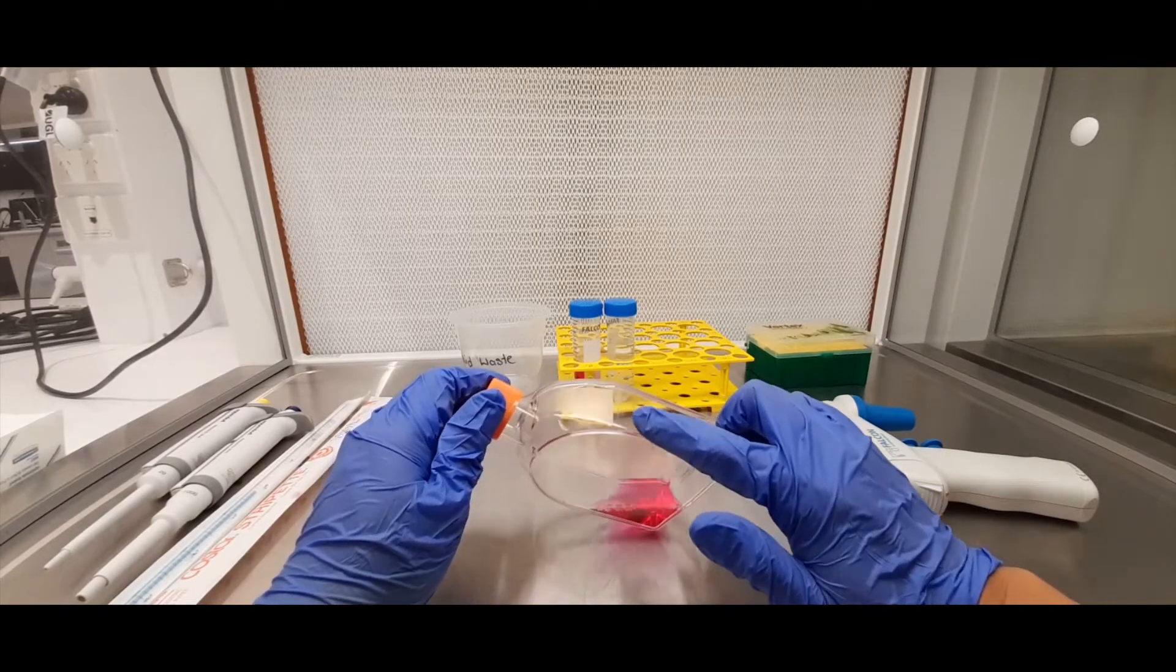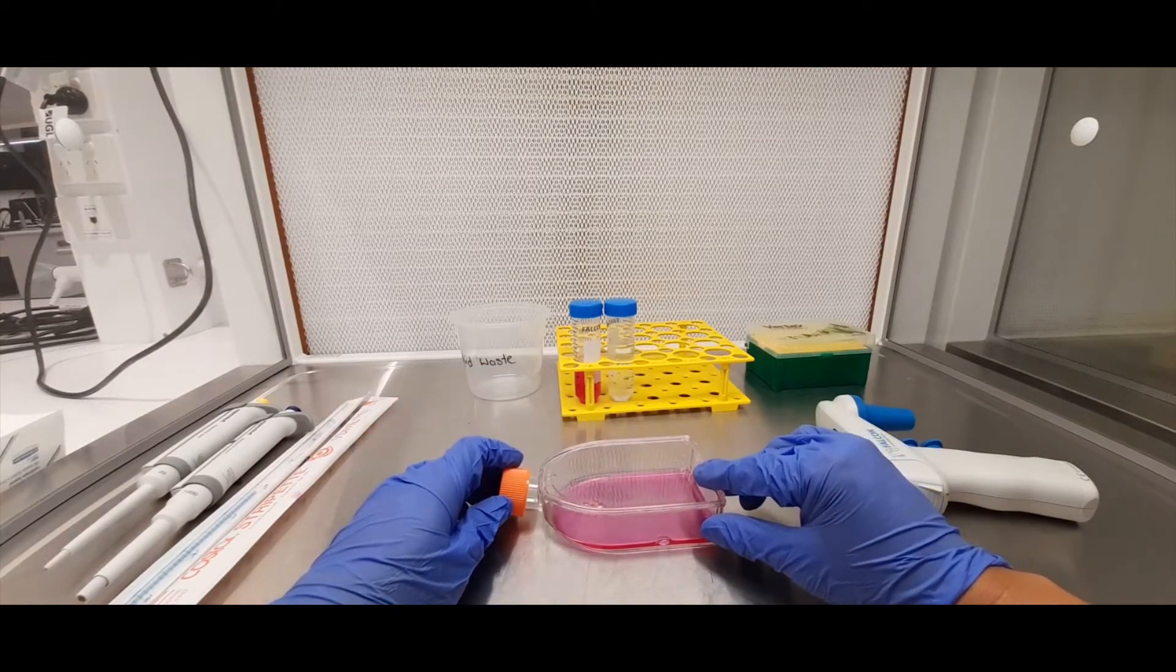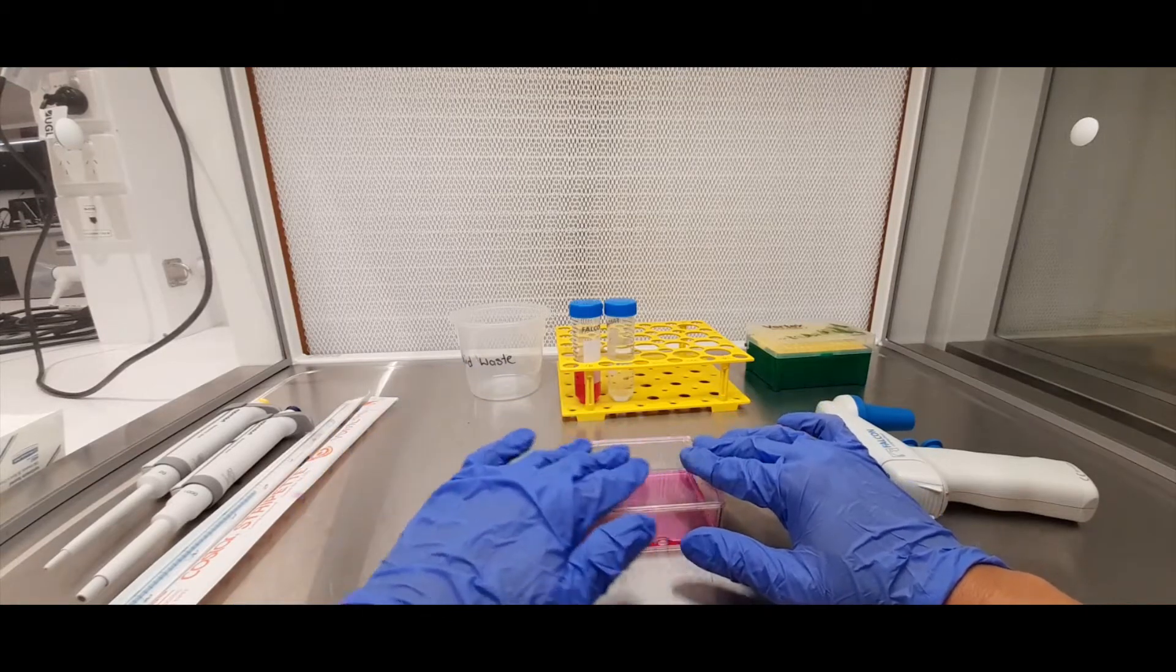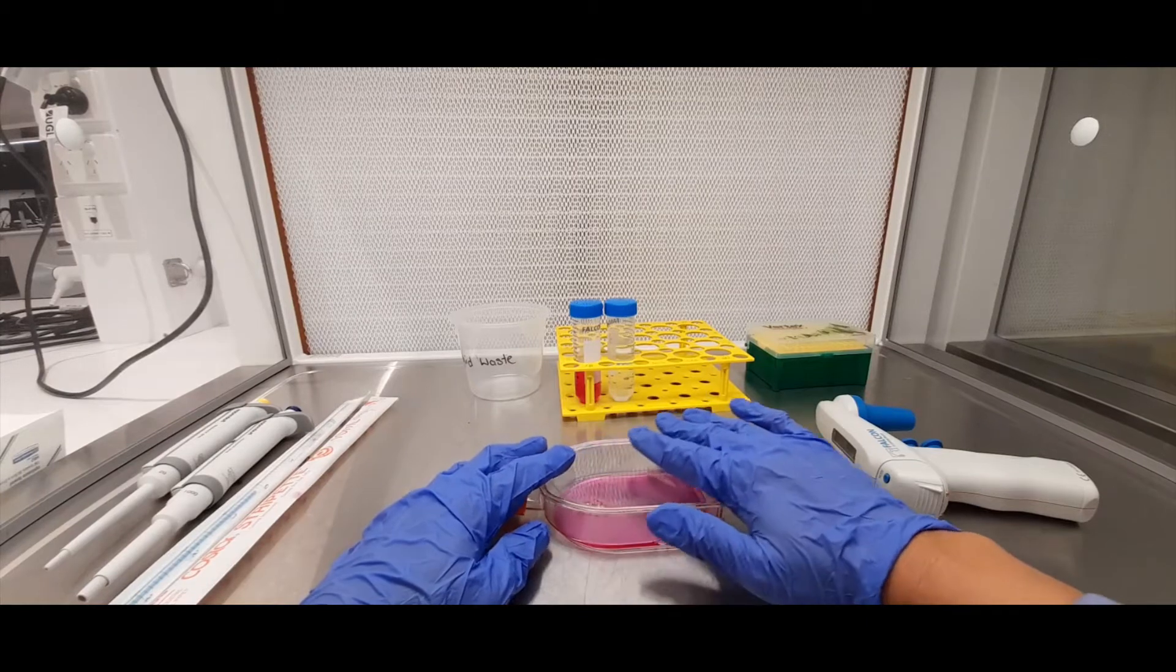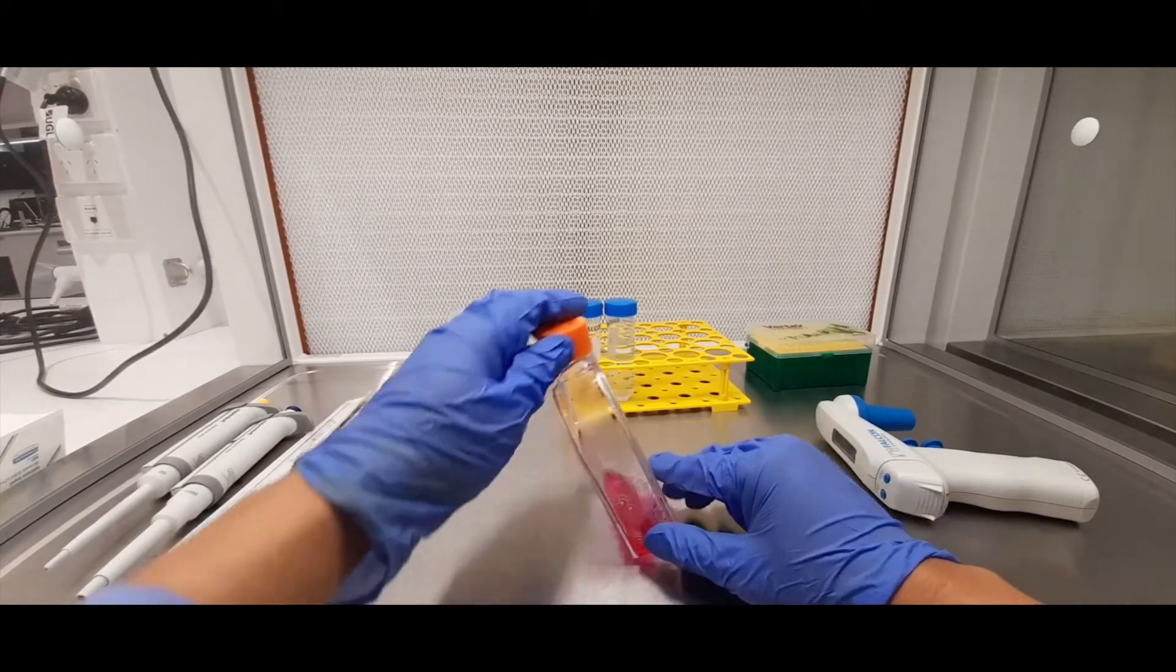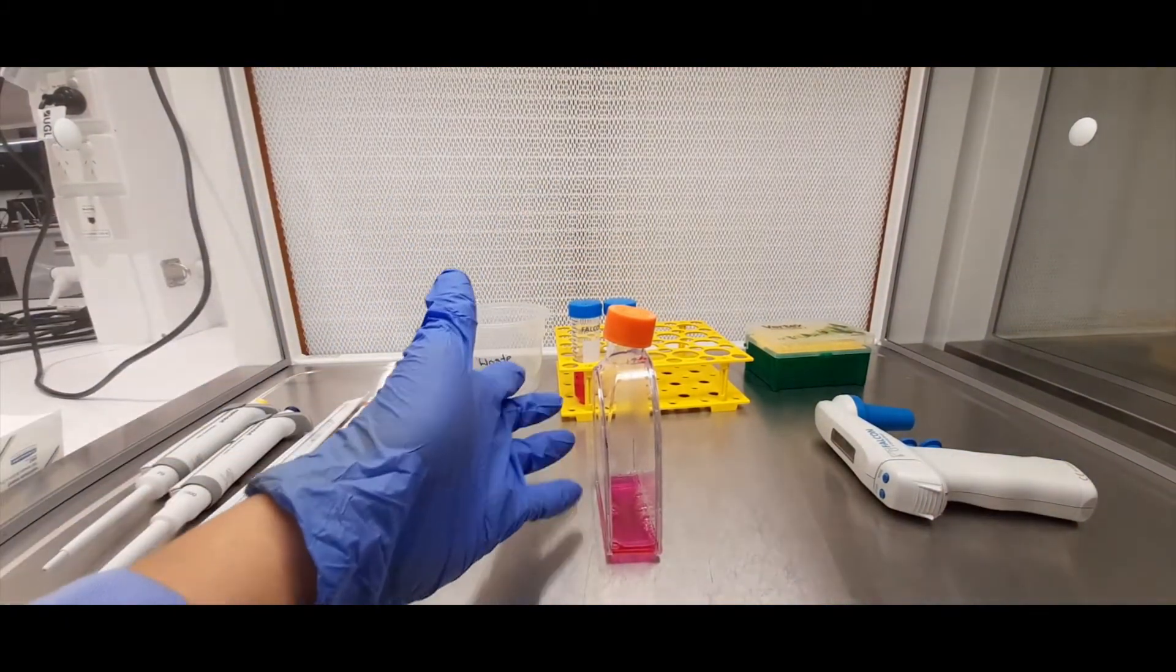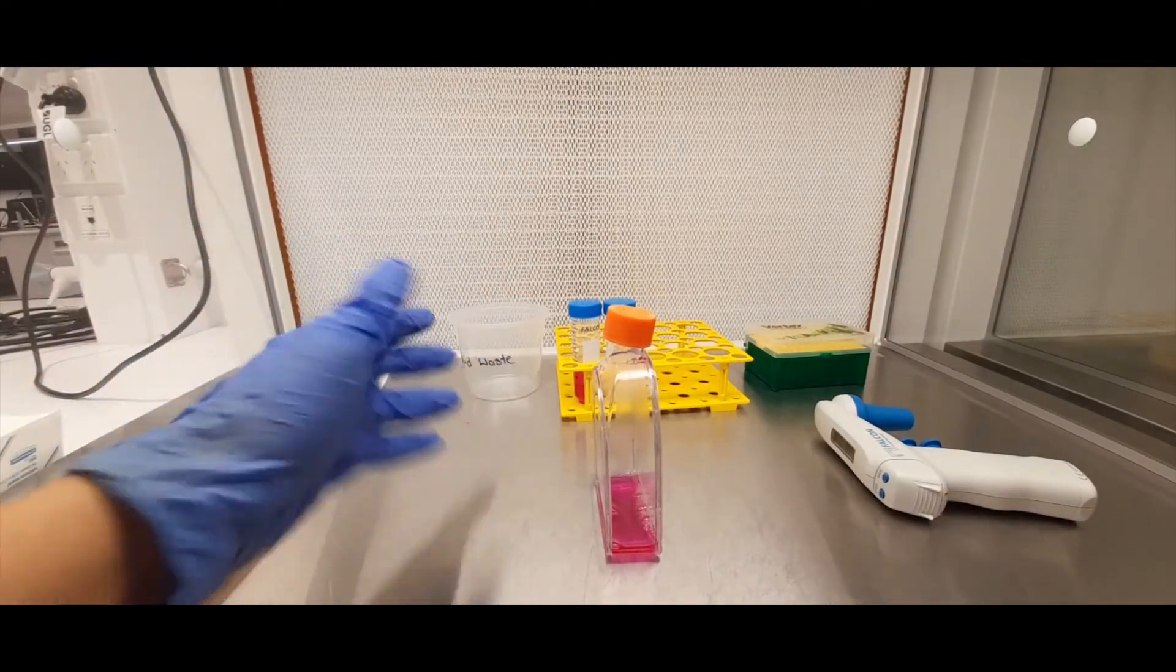So when you've got your cells in here, you want to have them laying down horizontally like this so the media stays covered, so your cells stay covered in media. So what you don't want to do is have it standing up for any prolonged period of time because your cells there are not being covered by media so they will eventually dry out and die.